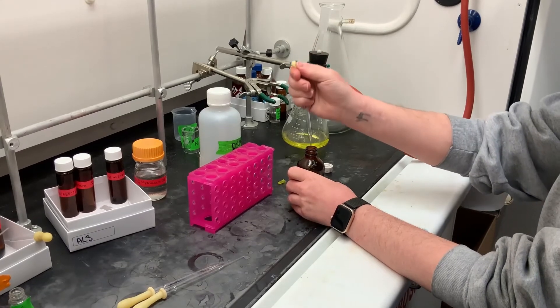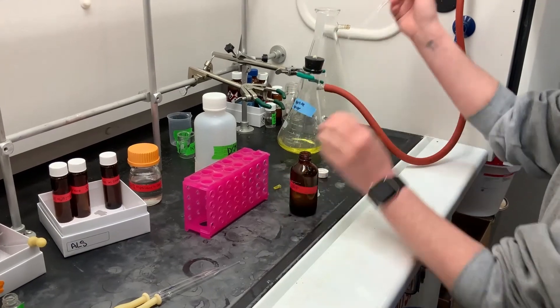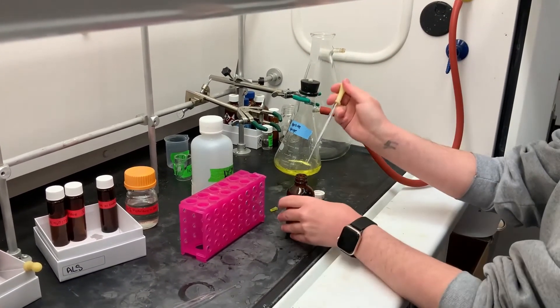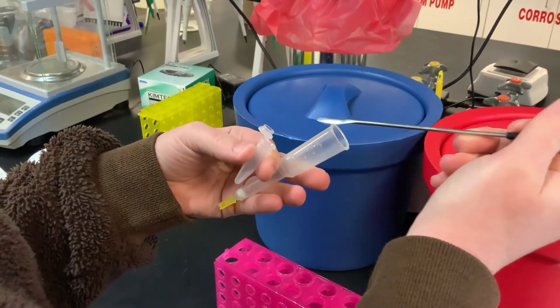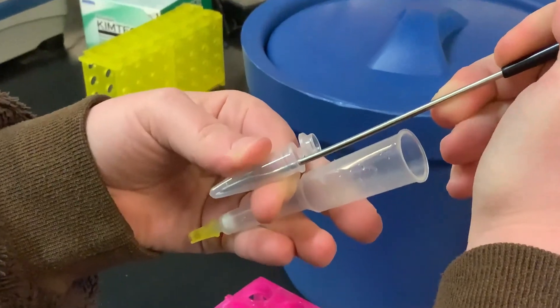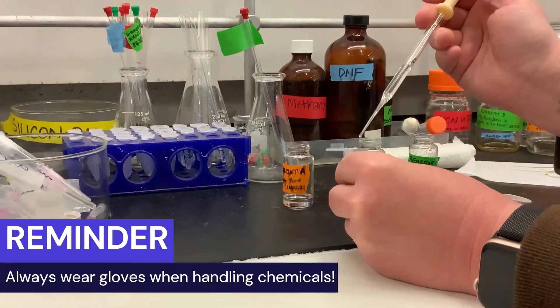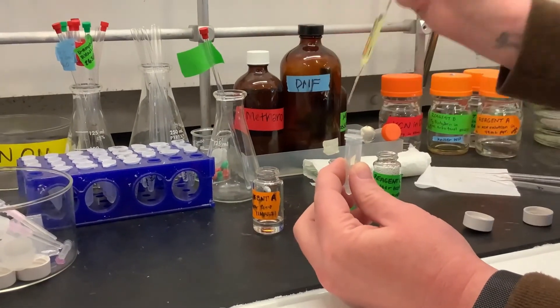Before conducting the ninhydrin test, you should wash your sample three times with DMF after your deprotection or coupling step, then wash once with DCM to dry the resin. Collect 15–20 beads of resin from your sample and put them in a centrifuge tube. Add two to three drops of Reagent A, B, and C to the tube before capping and placing on the heat block.